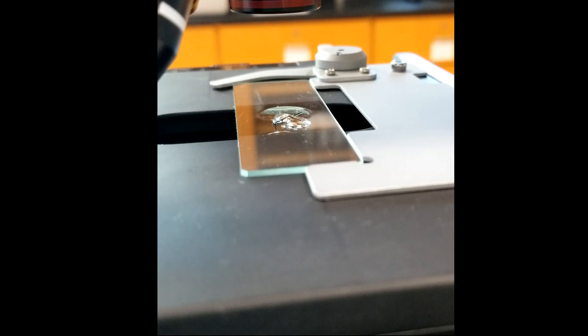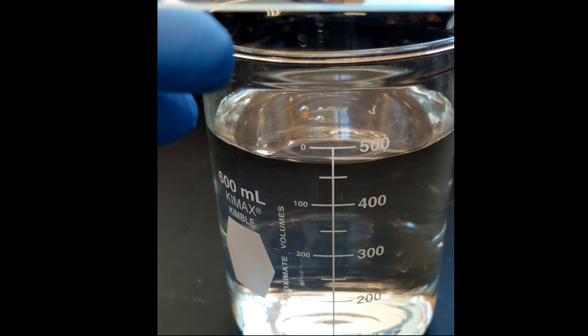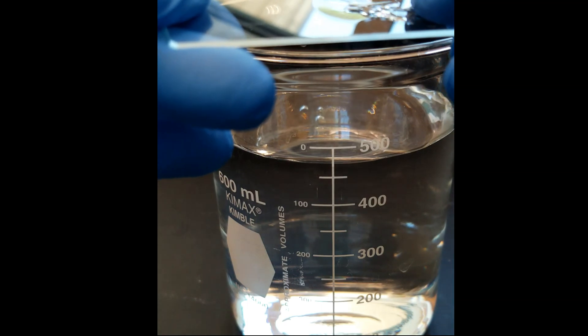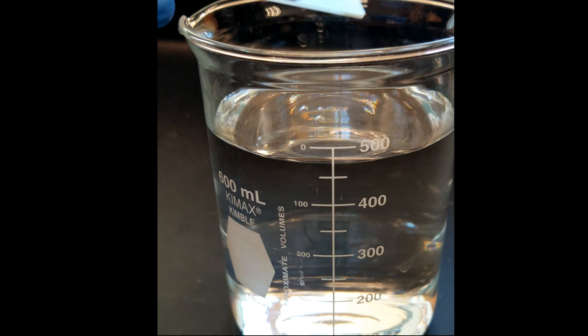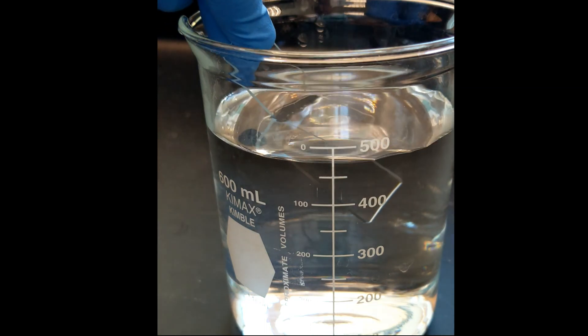Once you are finished with your experiment, replace the last test solution around the Daphnia with water, remove your slide from the stage, take off any existing threads, and dip the slide and the Daphnia into the recovery chamber.